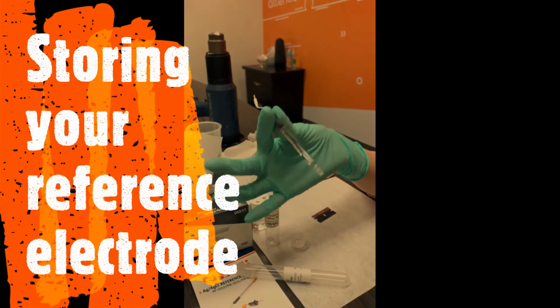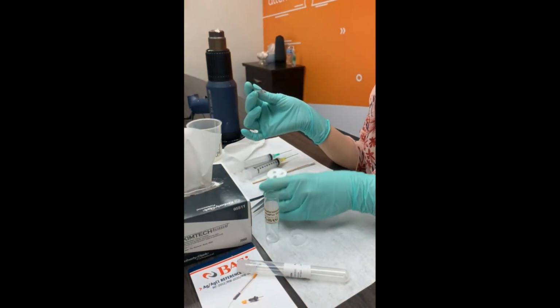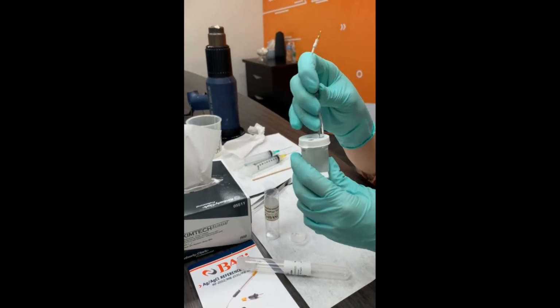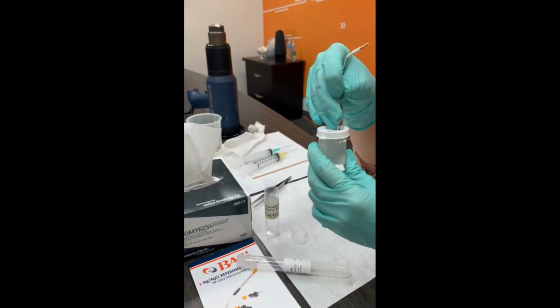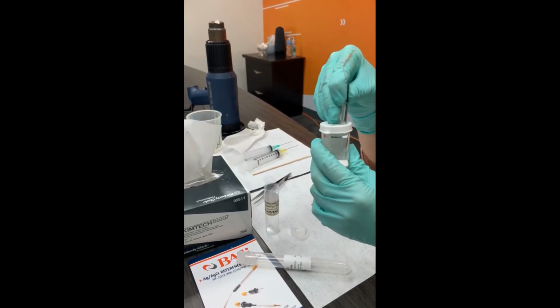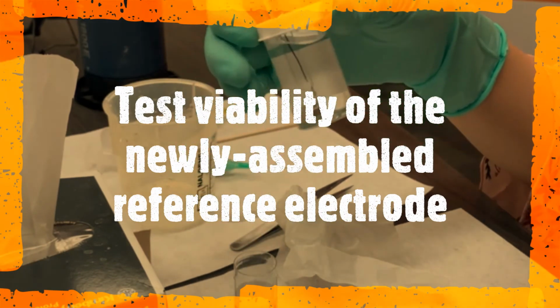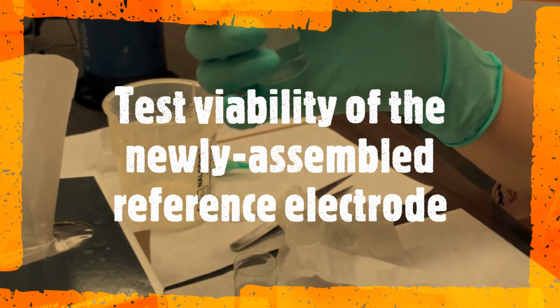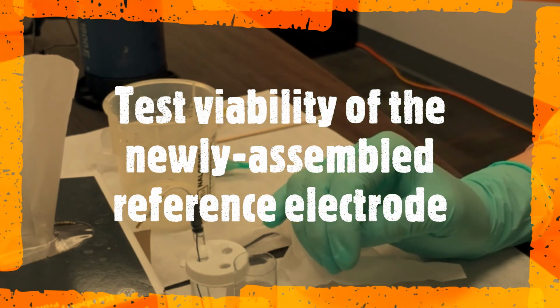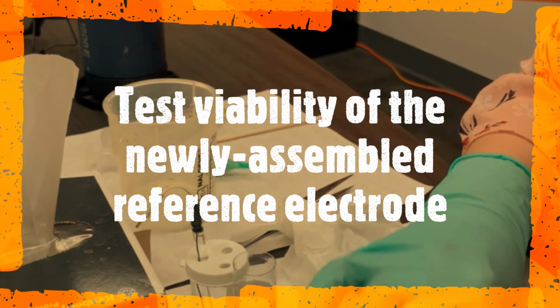So the next step is to store this in your storage vial with your saline solution for at least overnight, 24 to 48 hours, and the reason is you want your new CoralPor Frit to equilibrate with your solution before you actually use it. After 24 to 48 hours of equilibration with your saline solution, make sure that you do the viability test using a voltmeter against your master reference electrode.